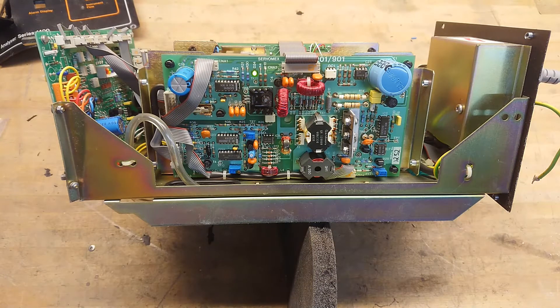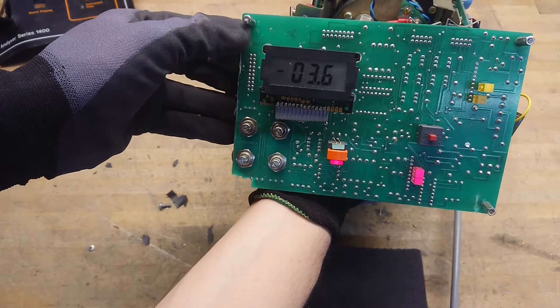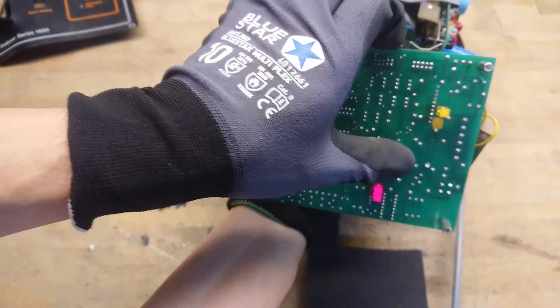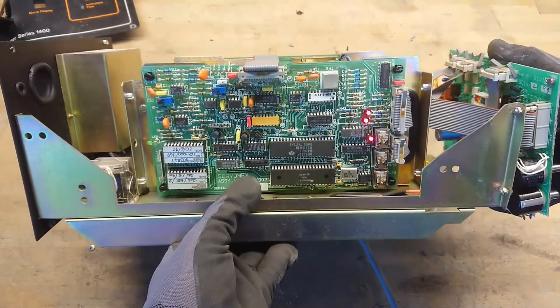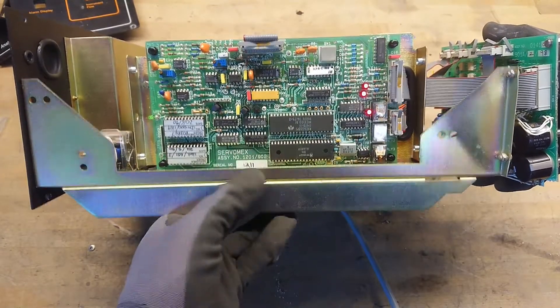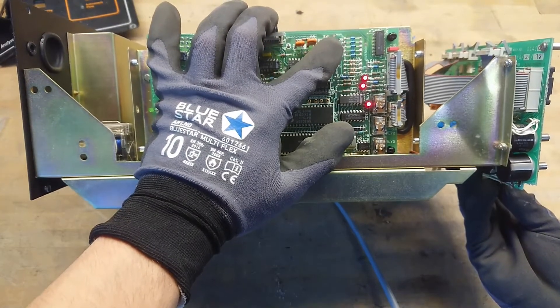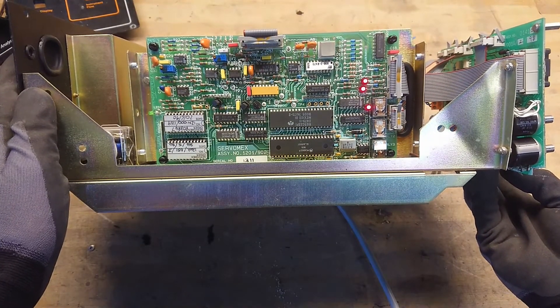It blinks at the front for alarm. Here we can see it says minus 3.6 percent. We have the alarm status blinking, and we have the flow missing — and this was the range selection. On the other side with the microcontroller, we have LED 2, 3 and 4 turned on. I wonder what that switch does — maybe it's a reset switch. It makes a little squeaky sound from the electronics, but other than that, no change in the front panel or any LEDs.